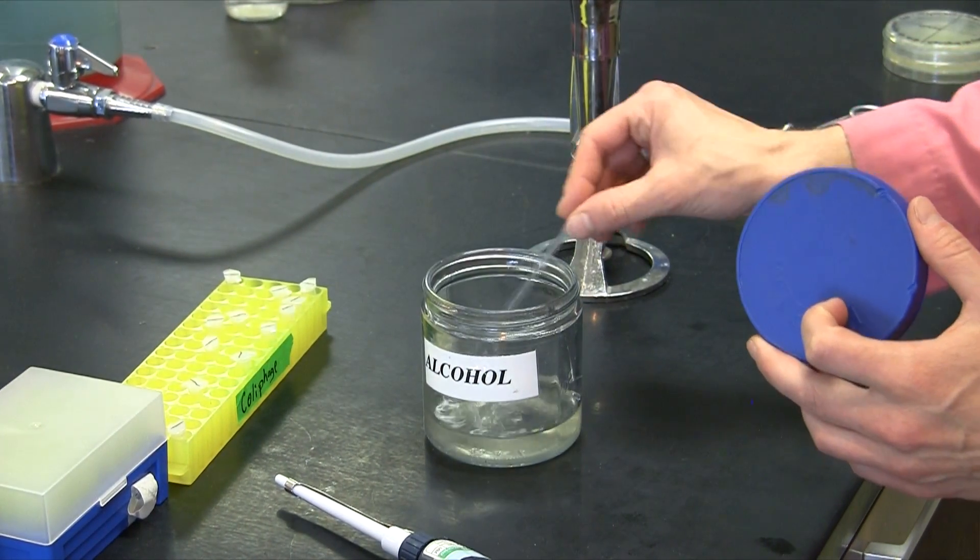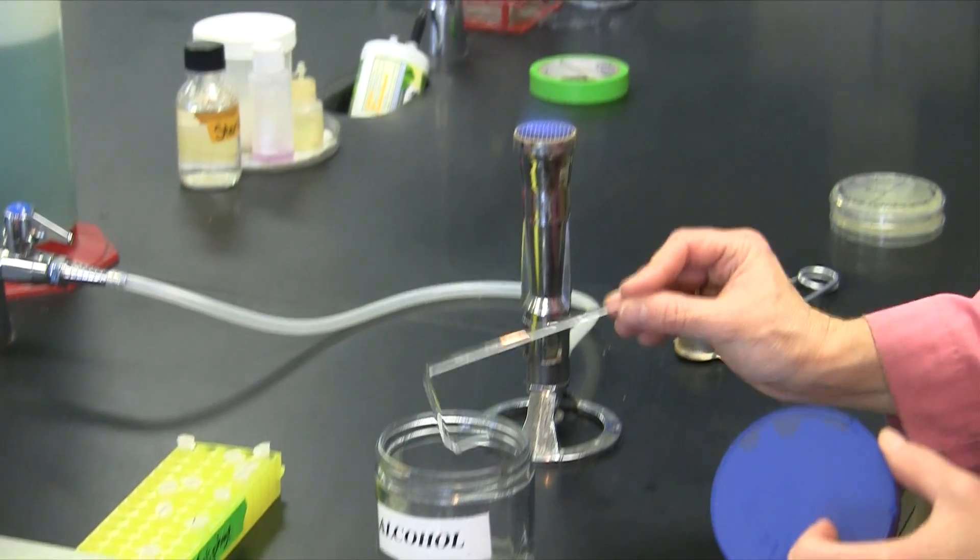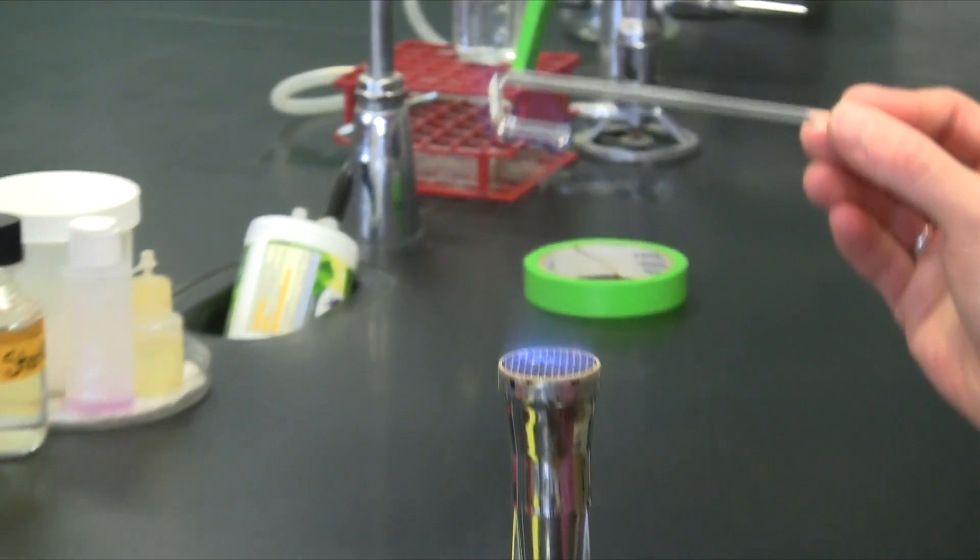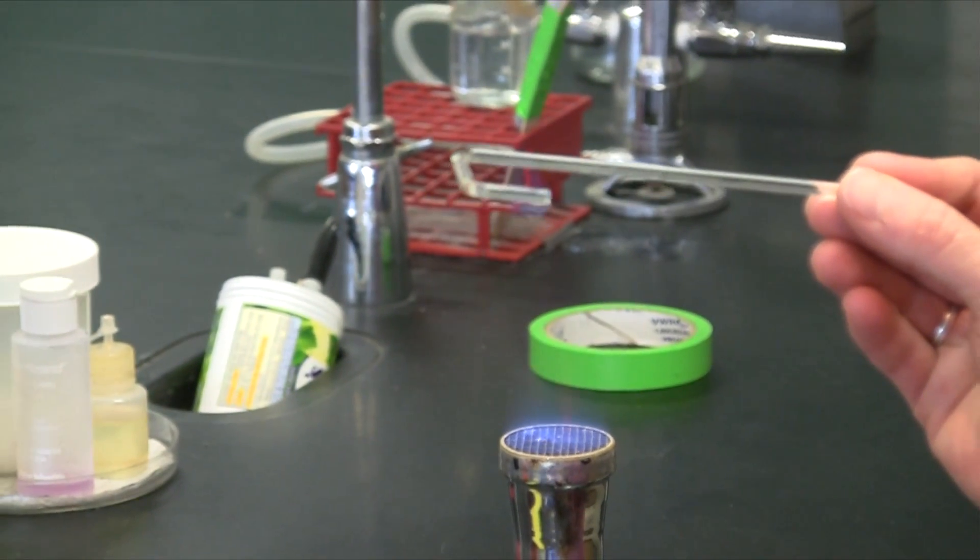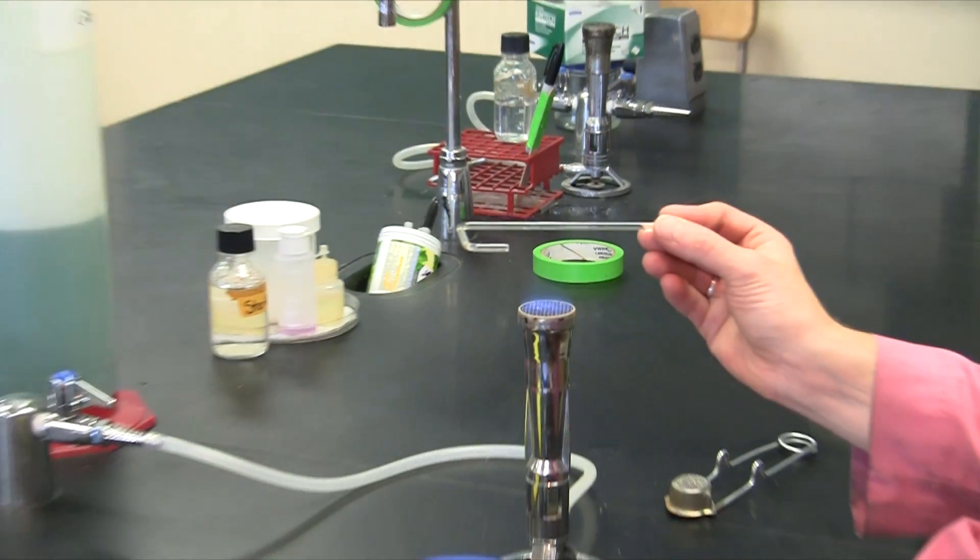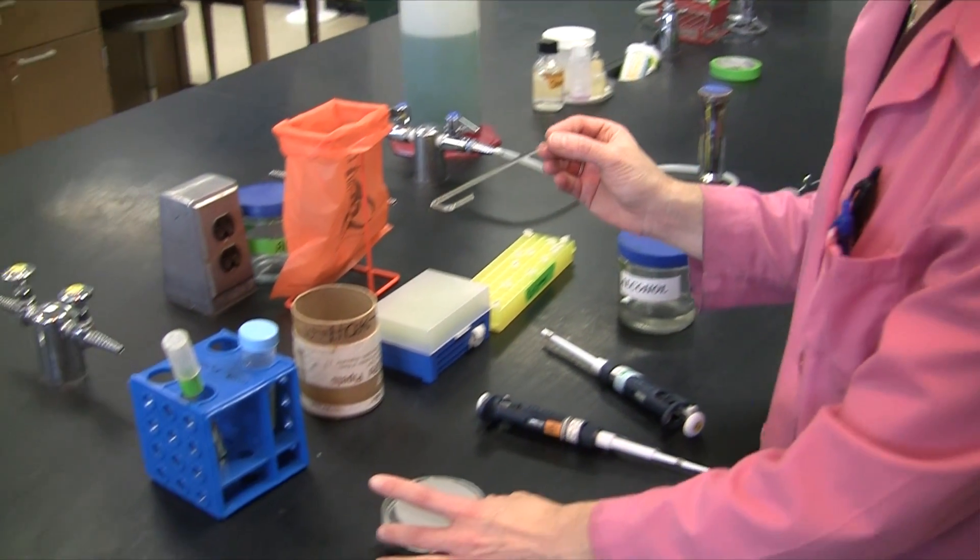So this is the fun part. We get to use alcohol. Do your dip in the alcohol and just a single pass through the flame, allowing the fire to burn out on the bar before you get going.